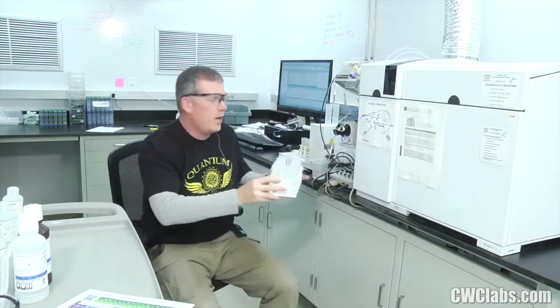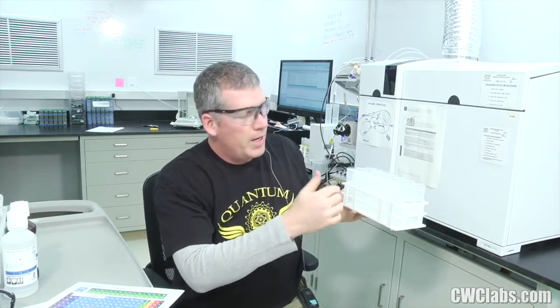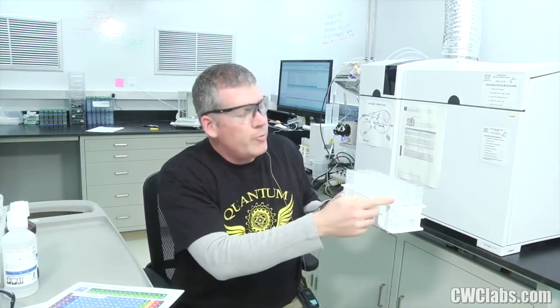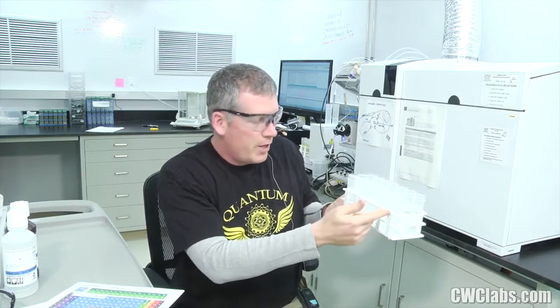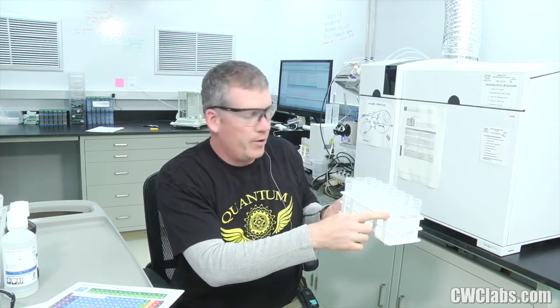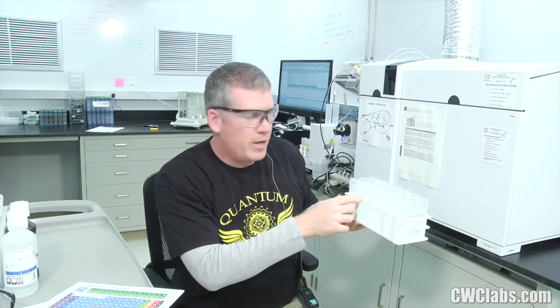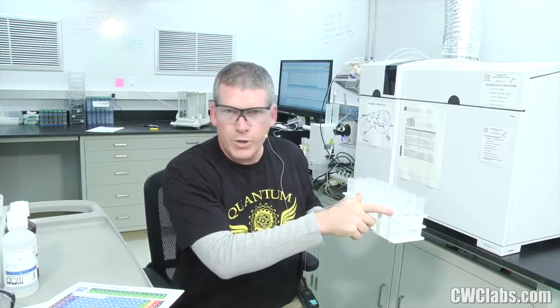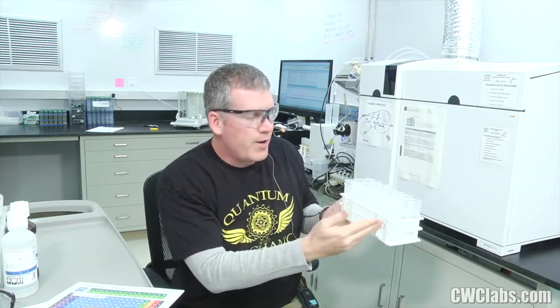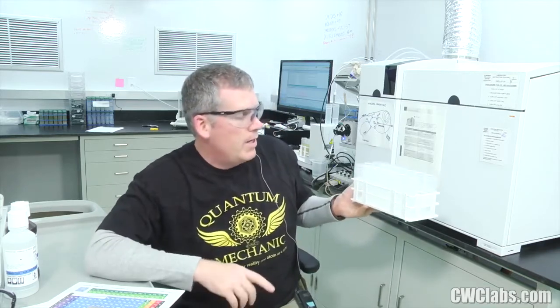If you're running, let's say, a serial dilution set of standards here, and in this case, I'm running multi-element standards at like 0.8 parts per billion here, all the way up to 3,000 parts per billion here. I have a very wide range of calibration, and I use factors of 5 from vial to vial. There's a very important reason for that. I'll talk about that in an upcoming episode on pipetting.